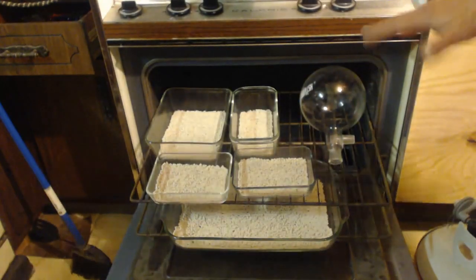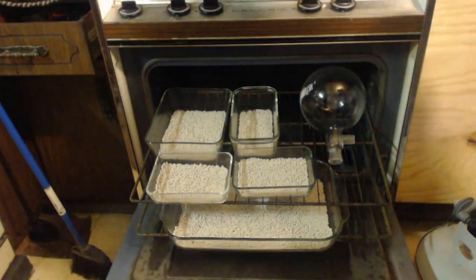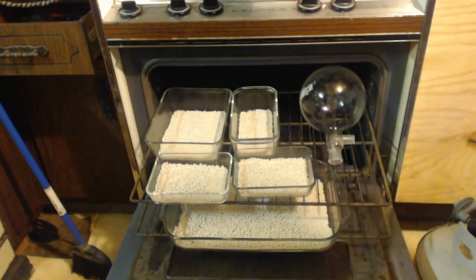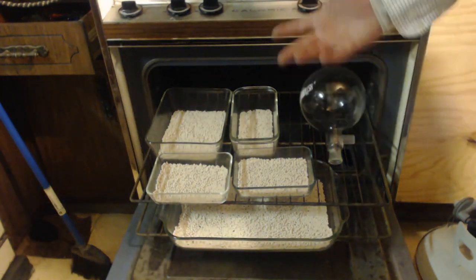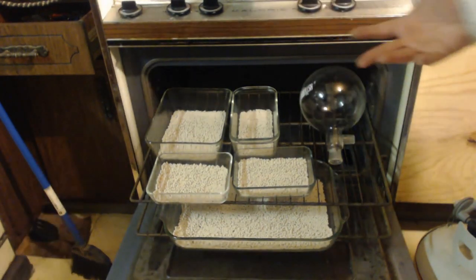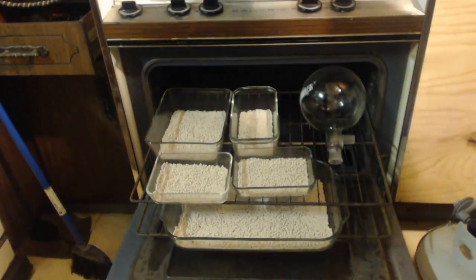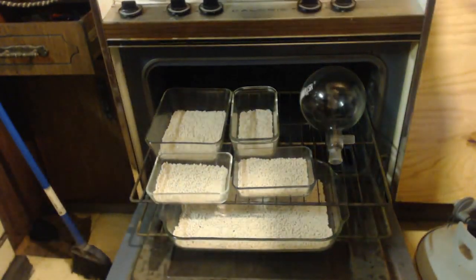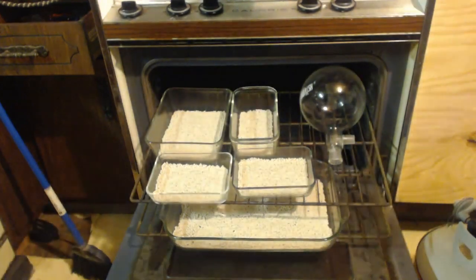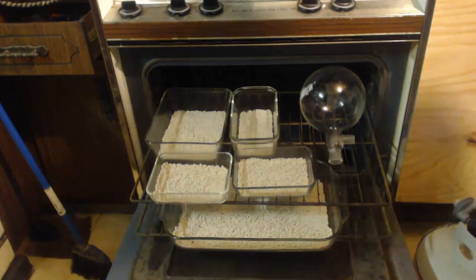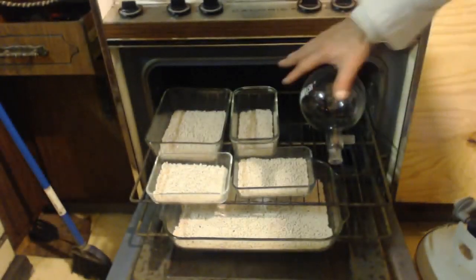Angstrom or 3A Angstrom, I mean 3 Angstroms or 3A. Angstrom means just a size. I think it's 100 picometers. But they use that for molecule scale stuff. Like the hydrogen on a molecule is 100 picometers or 150 picometers from the carbon atom. That kind of thing. So that 100 picometers would be one Angstrom.